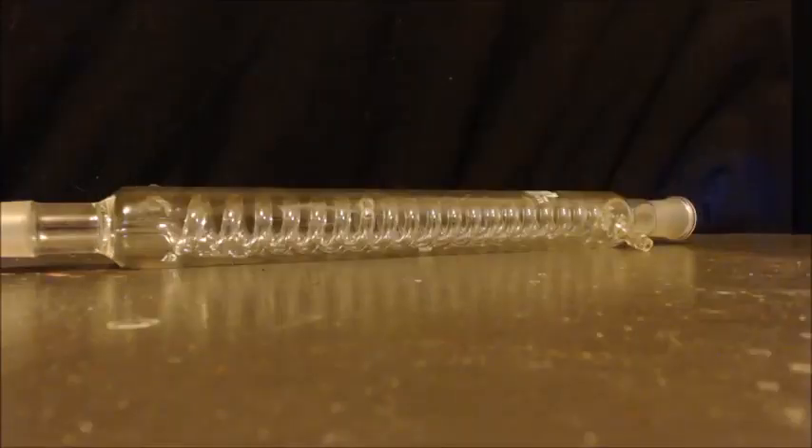When you're done filtering out the MnO2, check if the filtrate is clear. If it has any purple color, everything needs to go back into the pot and be refluxed more until that purple is gone. Even the filtered MnO2 should be washed with water and thrown back in to reflux. Until that purple disappears when you filter, your reaction isn't done.